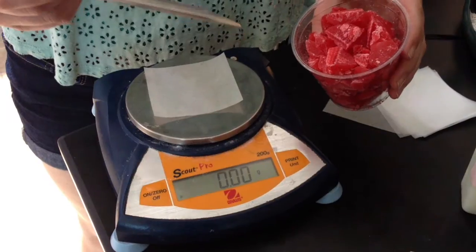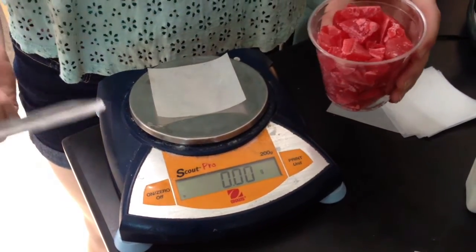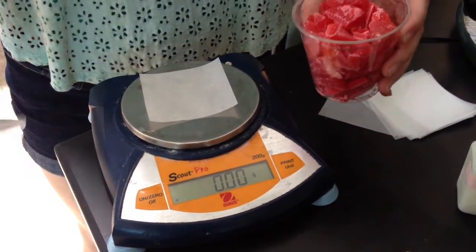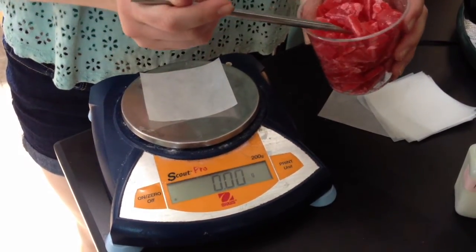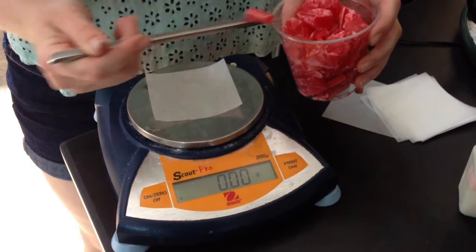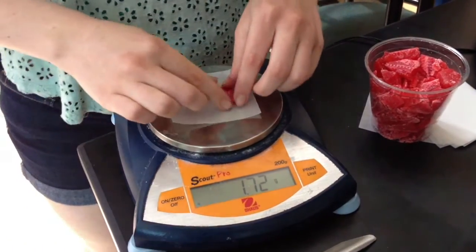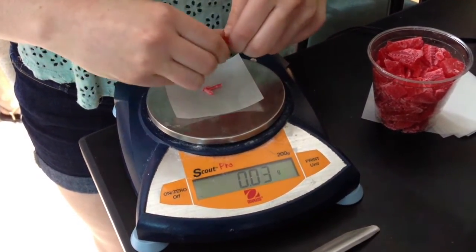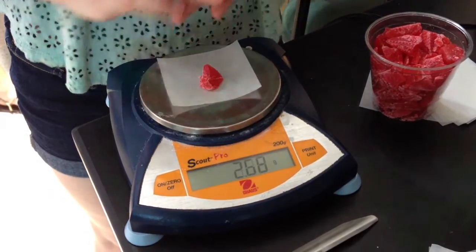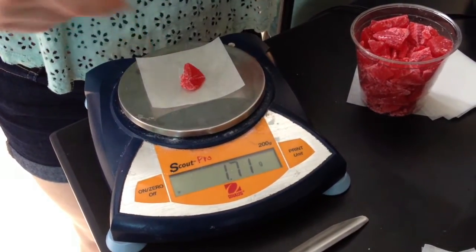Here's how to measure out your unknown substance. You're going to want to measure out and carefully record the exact amount of grams that you're going to be dissolving in your solution, because that's essential for the calculations at the very end. Don't eat this stuff. It looks like candy, but it's not. Measure out the amount on the scale. It crumbles pretty easily, and you can break it up with your hands if you need to. Just make sure that you wash your hands afterwards. And Mr. Ozuna will tell you the amount that you need to use. We're going to be using about this much.